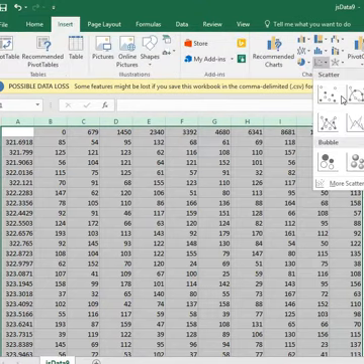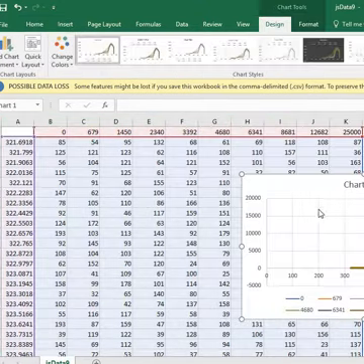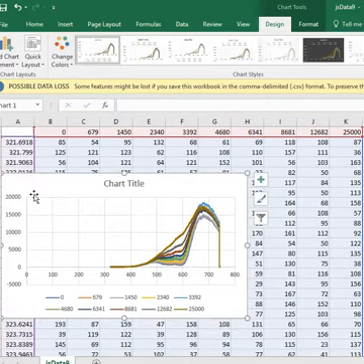Insert chart, scatter plot, and that's what the raw data look like. Once you have the raw data, you can convert it into absorbance. You can do whatever kind of background subtraction you want to do, and that is going to be the subject of another demo on another day. We're working on a user interface for spectral analysis, but that's not part of this talk.